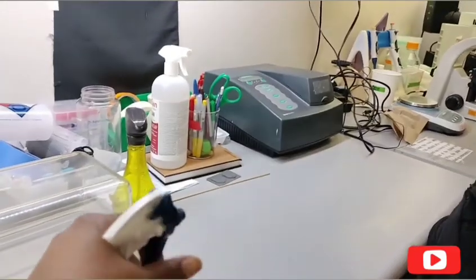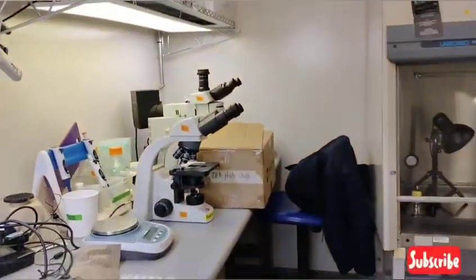I'm going to just wipe down my bench, and I also am seeing things that people have used and left on my bench and haven't put back where they got it from. Like, what is that?